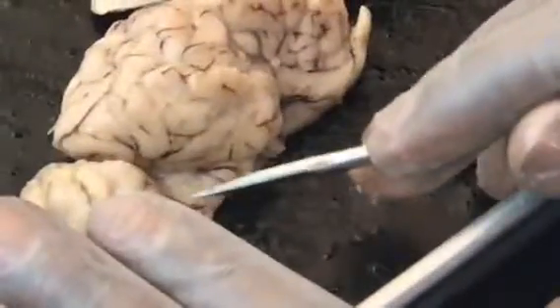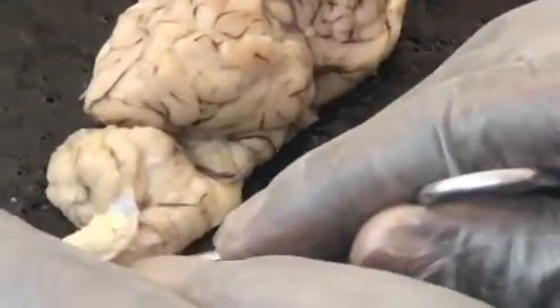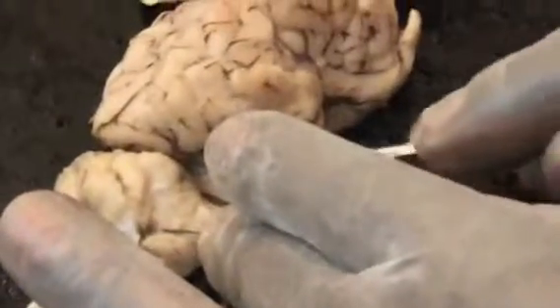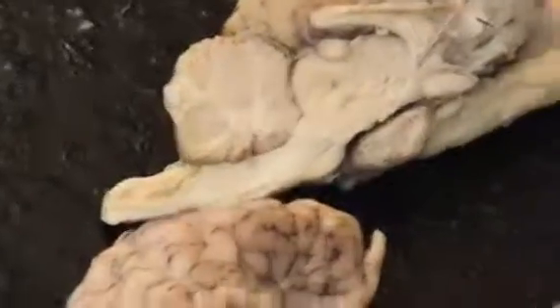The only thing I really can't find is your pons because there's a lot of stuff in there, but if I could find your pons, you remember, it should go spinal tract, medulla oblongata, then your pons. Then above your pons should be midbrain. So pons from this side, it should be around this area, but it's better over here because you can see it here. And that is everything. One thing I think we might have missed.